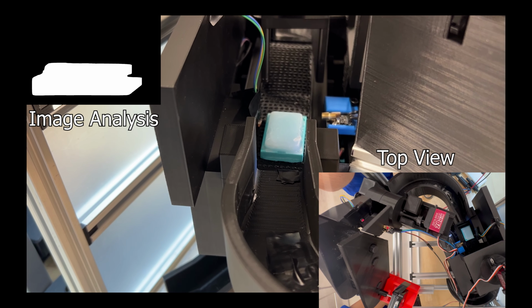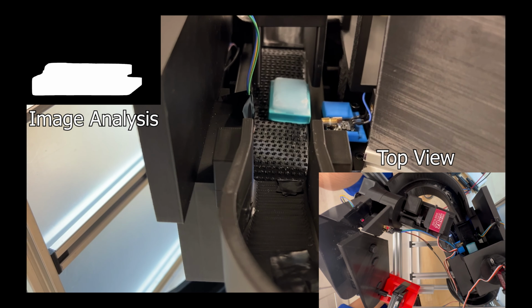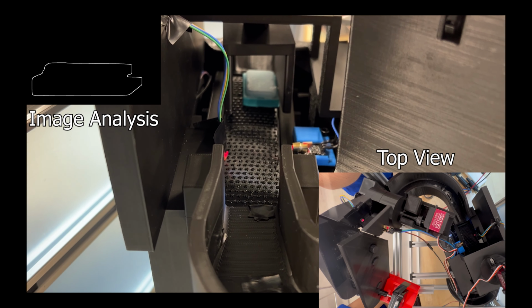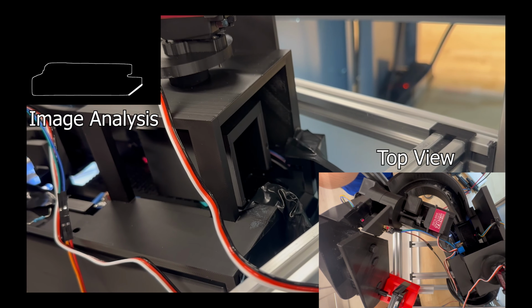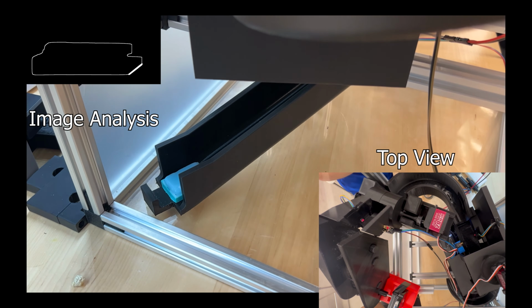The algorithm then finds all the lines in the image above a certain length. Those lines are then filtered to only capture those in the bottom half of the image and those within a certain tight angle range. Finally, once the desired line is found, the algorithm uses the sine of the angle and the x-coordinate of the line's endpoint to determine if the block needs to be rotated, as it does in this case. The block is rotated and sent down the output chute.